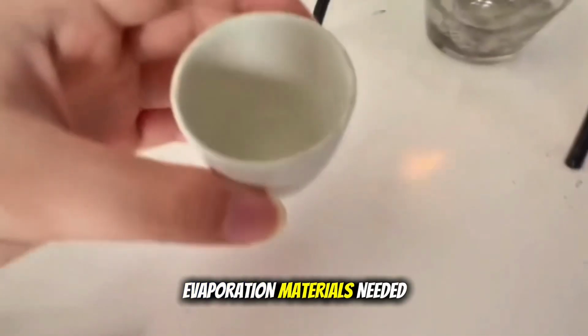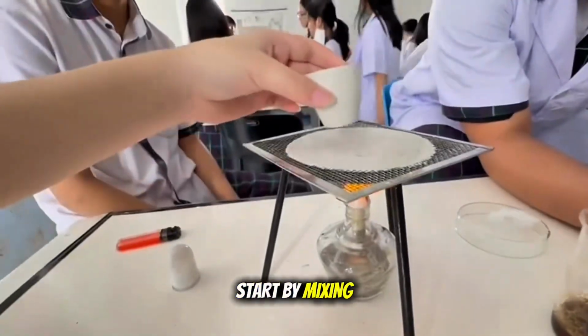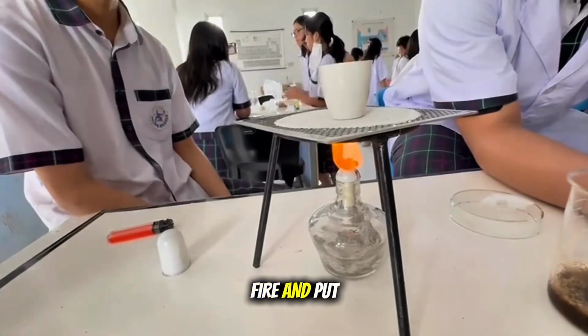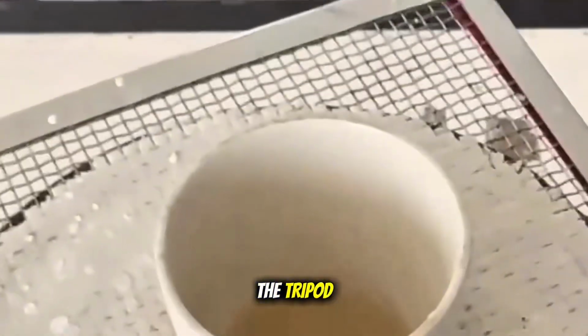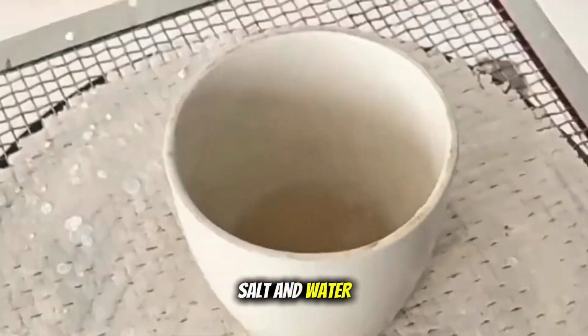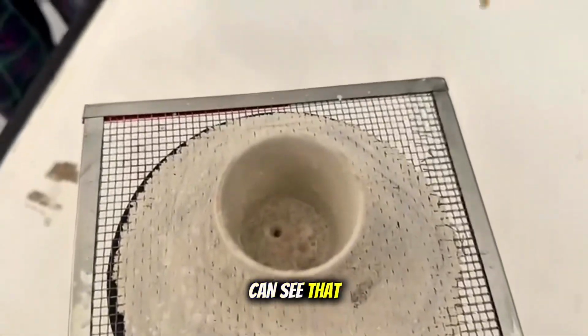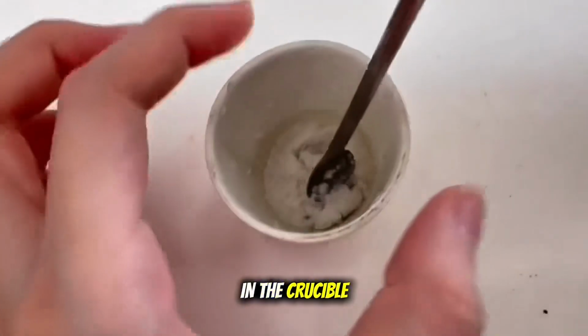Evaporation. Materials needed for evaporation are salt and water. Start by mixing salt and water in the crucible. Light up the fire and put it under the tripod. Place the crucible on top of the tripod and analyze the salt and water mixture. Wait for a few minutes, and now you can see that the water has fully evaporated and what's left in the crucible is the salt.